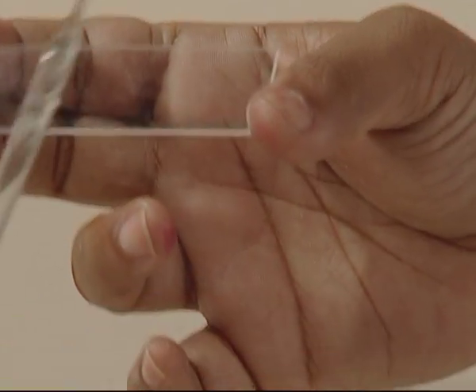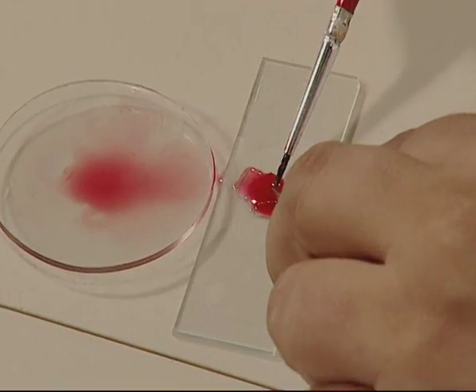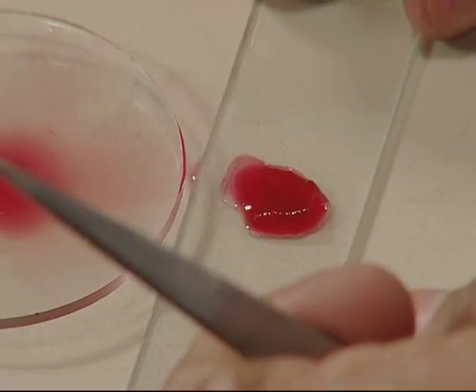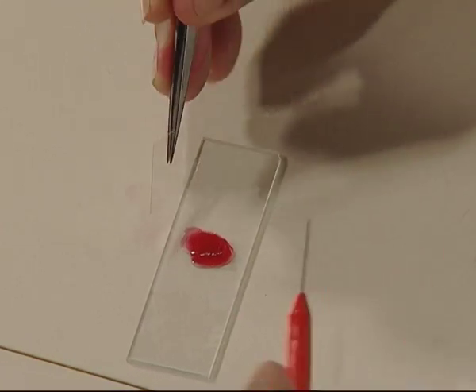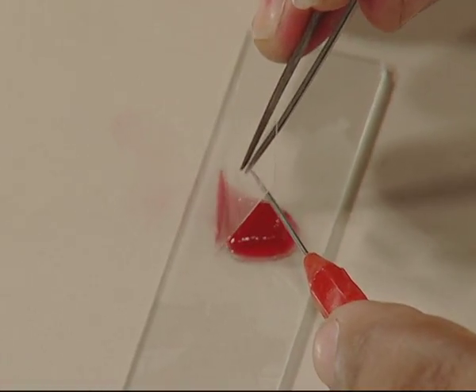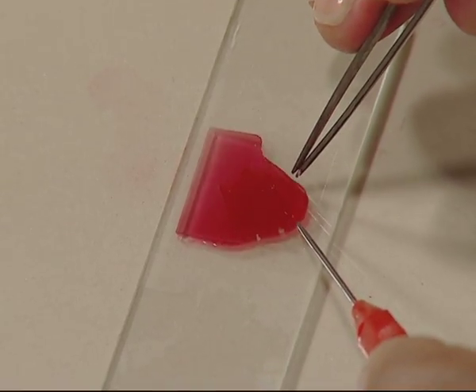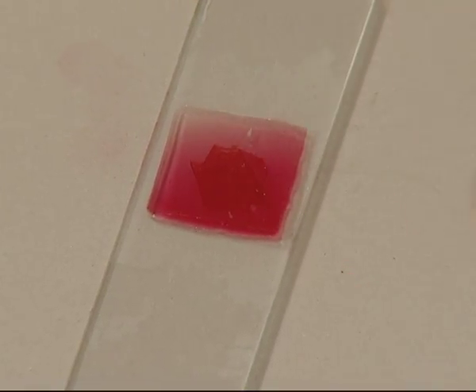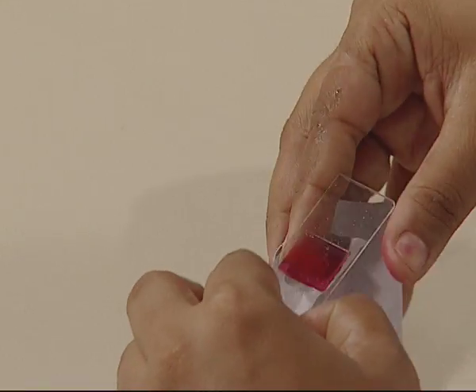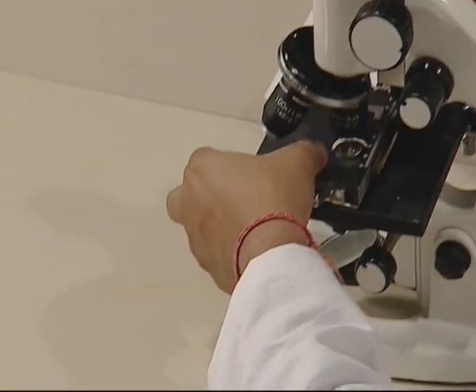Now take a clean slide and put a drop of water in its center. With the help of the brush and forcep, transfer the peel onto the slide — take care that you do not fold the peel. Take a cover slip and slowly, with the help of a dissecting needle, place it over the temporary mount so that there are no air bubbles. Take a filter paper and wipe the extra stain from the corners. Our temporary mount is ready for observation.